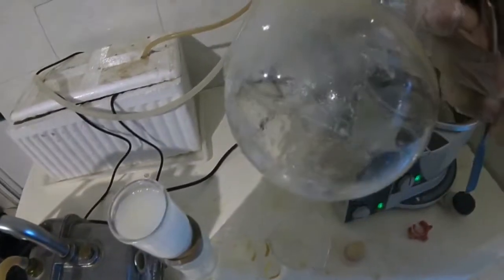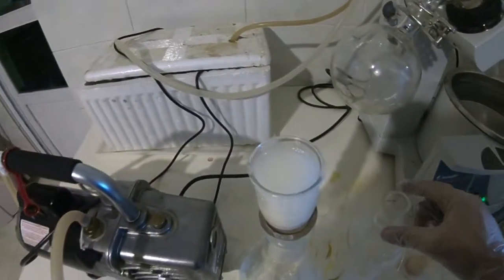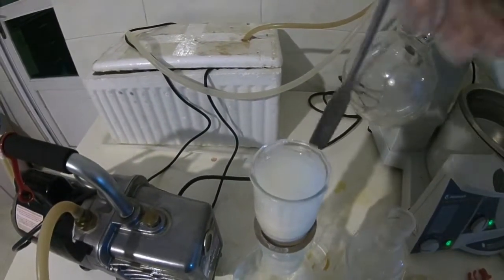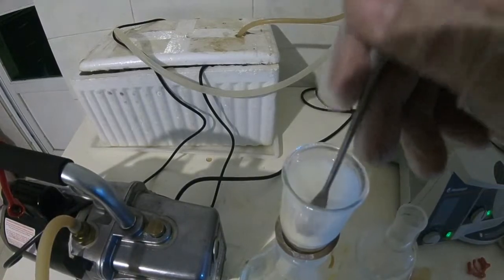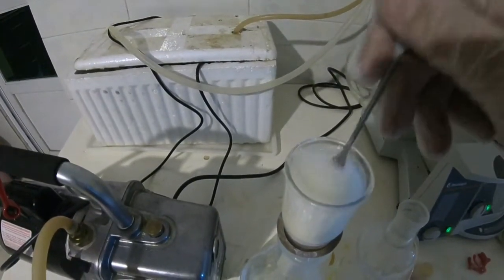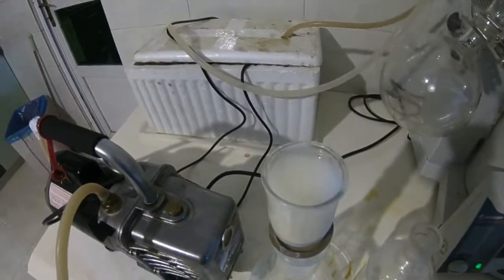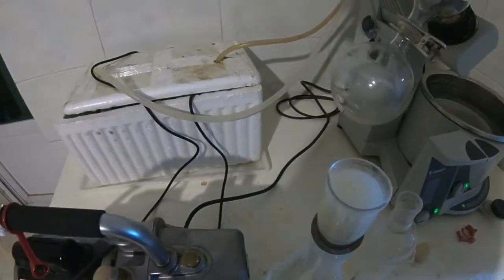I transferred all of the crystals in there and I put some cold methanol to wash them, and I crushed all the big chunks to smaller size so they can be washed.